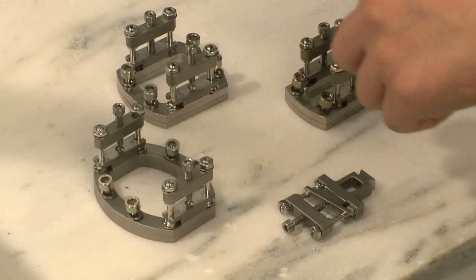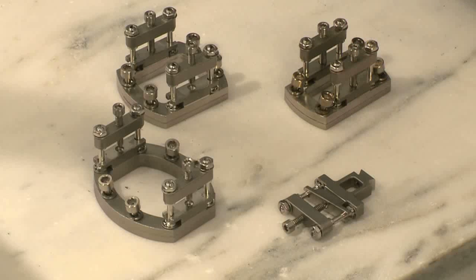10mm, and 4mm. The single cantilever clamp is using half of the size of a dual cantilever clamp.